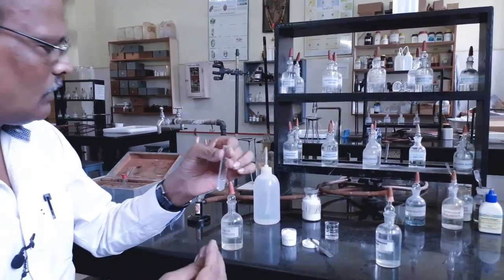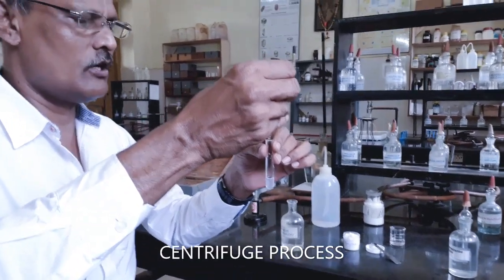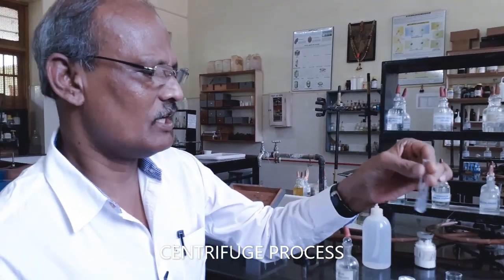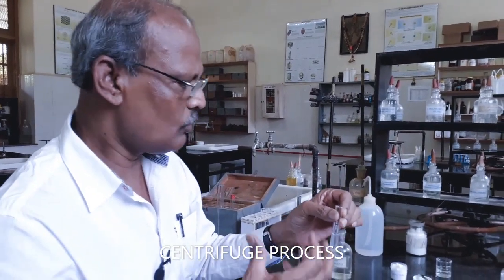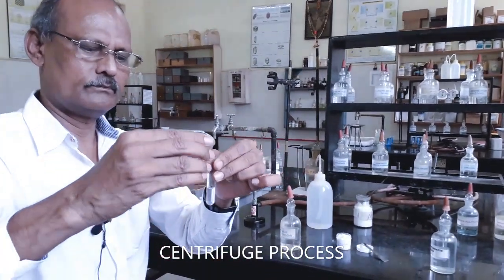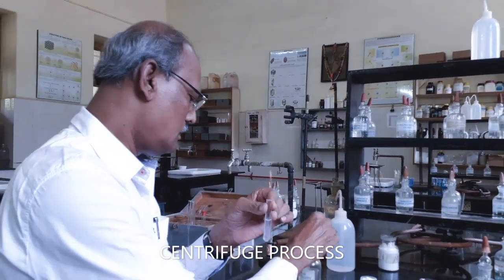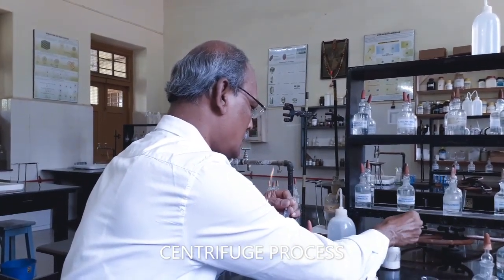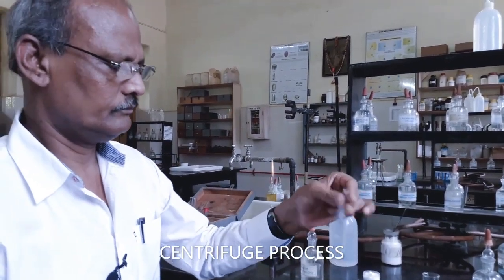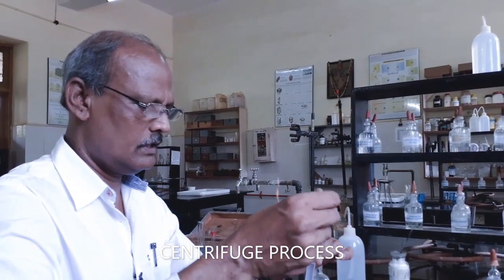In order to get more white gelatinous precipitate, I am going to add some more original solution, some more ammonium chloride, and a few more drops of ammonium hydroxide, to complete the precipitation of all the aluminum ions as aluminum hydroxide.